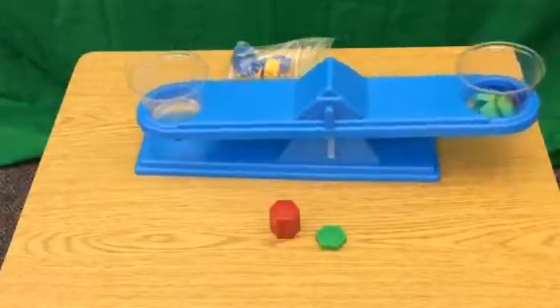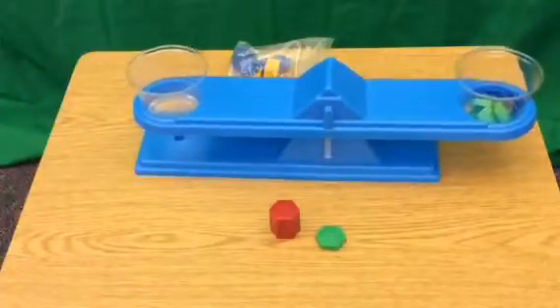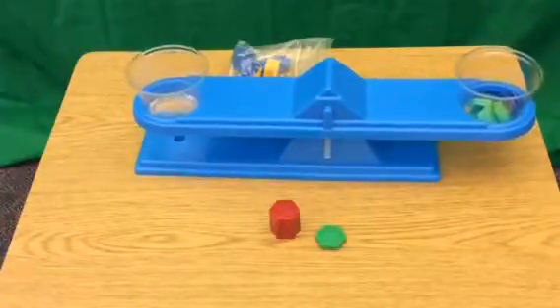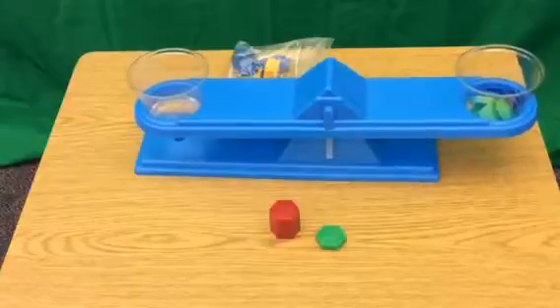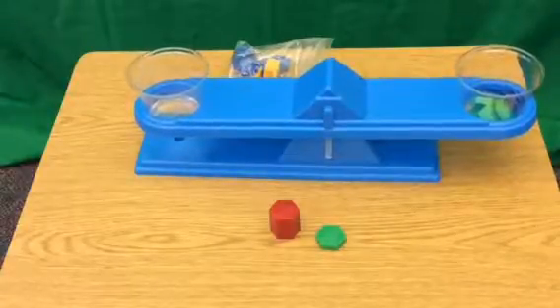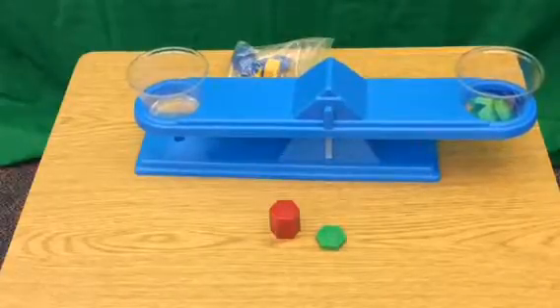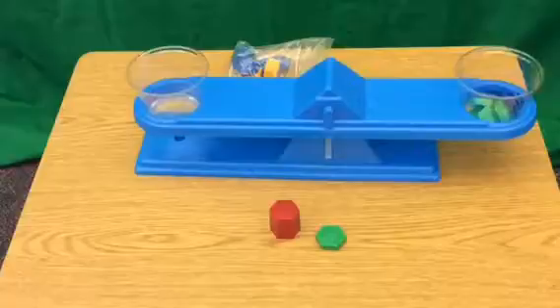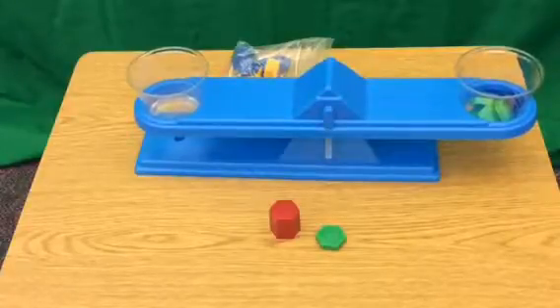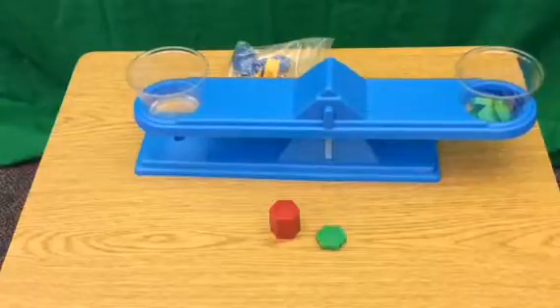Now I got it really rocking. If you want it to stabilize, you can do that to help a little bit. And if that white line is even with that blue line that's on our balance, then we know that we have equal amounts of mass. So my cup of water that I measured was 25 milliliters about, and 25 milliliters is equaling about 24 grams right now. I'd say that's pretty close. So that's how you use a balance.